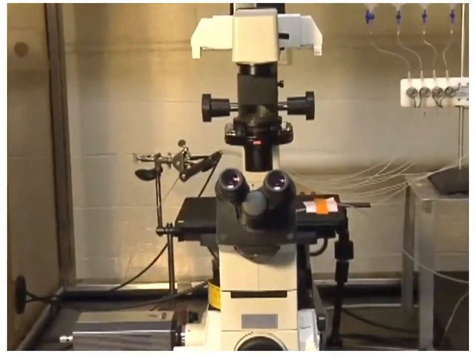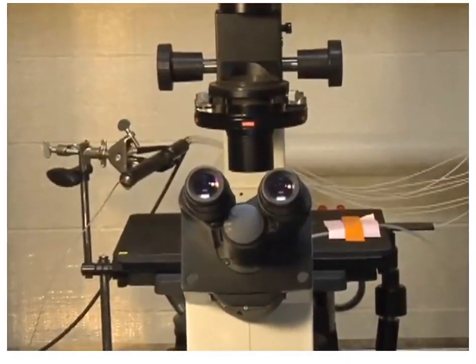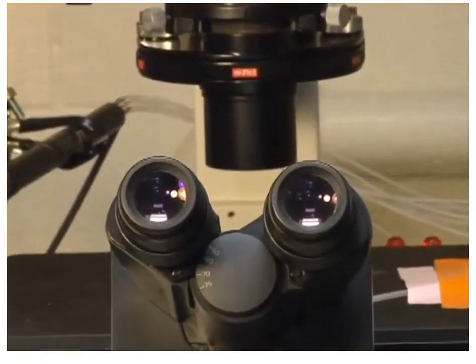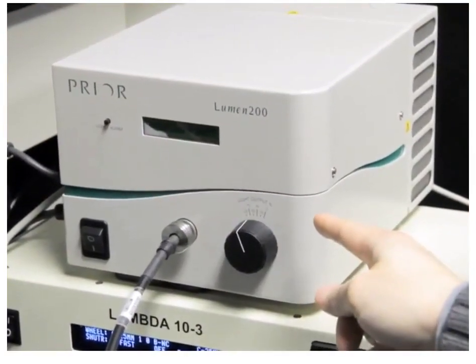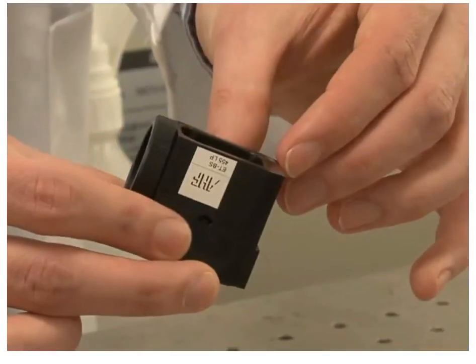The main components of the fluorescent microscope overlap greatly with the traditional light microscope. However, the two main differences are the type of light source and the use of specialized filter elements.